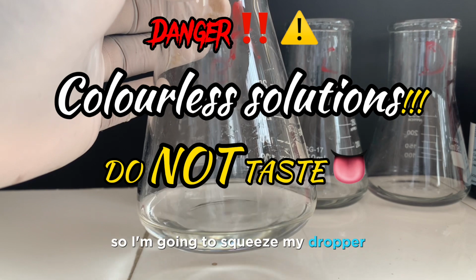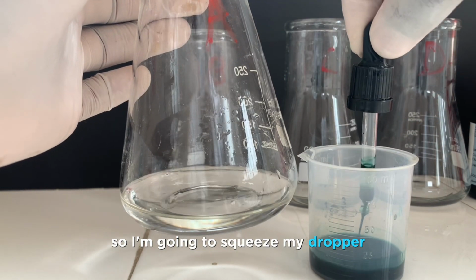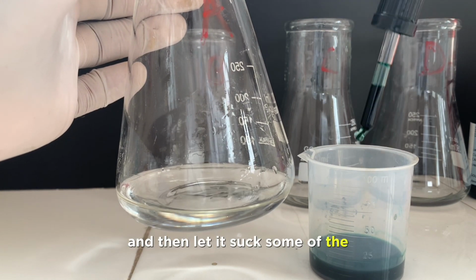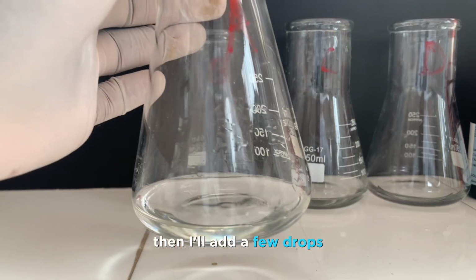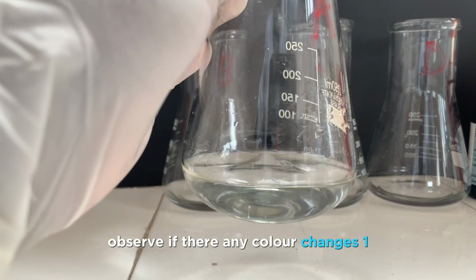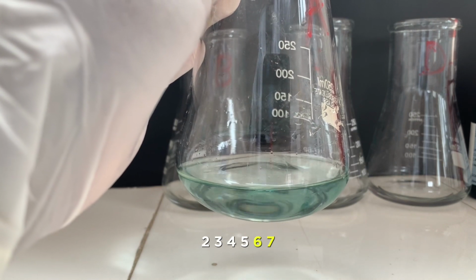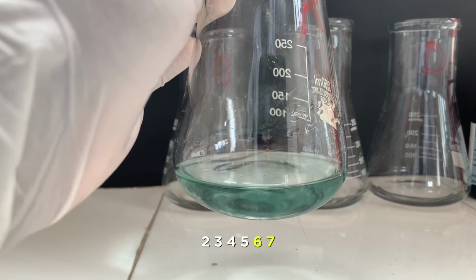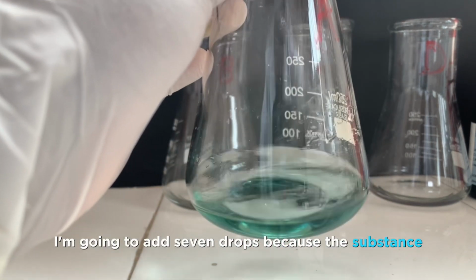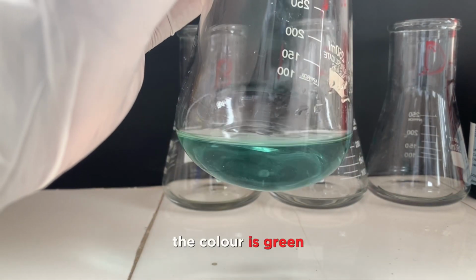So what you need to do is be careful, do not taste anything with your mouth or tongue. I'm placing my dropper into the beaker, squeeze it a bit so that it will suck, and then I'll add a few drops and observe for any color changes. I'm going to add 1, 2, 3, 4, 5, 6, and 7 drops. Also note here that because of the size of my container, I've added 7 drops, but it is not necessary. You can see the color change with just 3 or 4 drops.